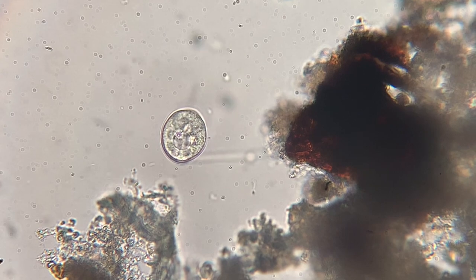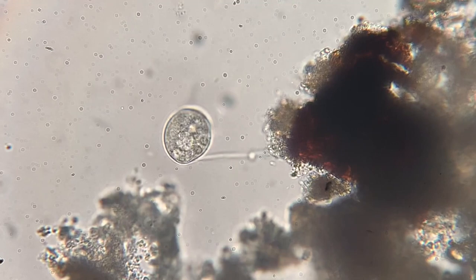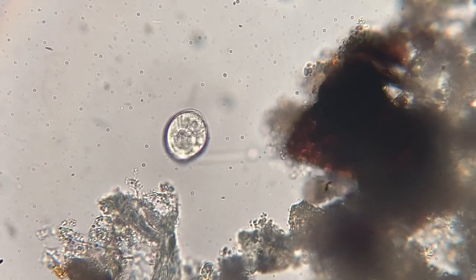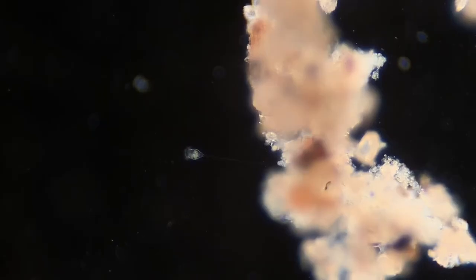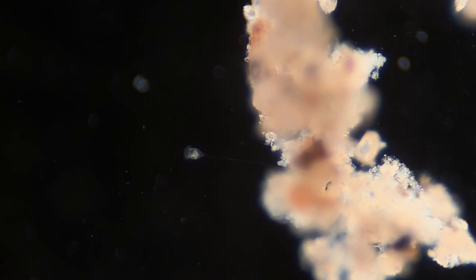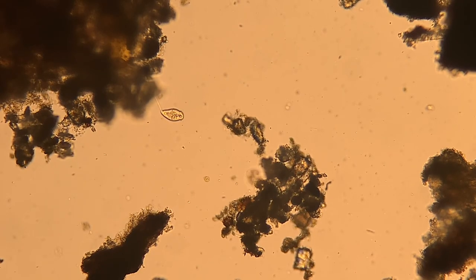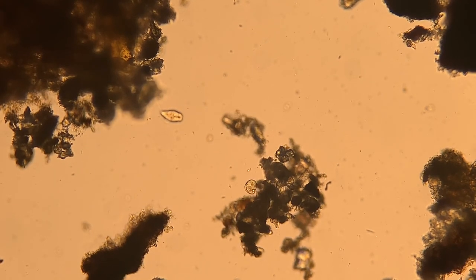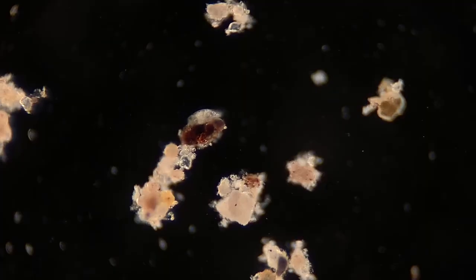This is a vorticella. Vorticella are really cool because they have a long stalk that they use to hold on to debris, and then they have special hairs called cilia, which they use to stir food, bacteria, and debris towards them for feeding. These guys are pretty common around the world. In fact, they've been found in the fossil record up to 200 million years ago, so they've probably been traveling by rain for that long, if not longer. Pretty cool to see those guys.